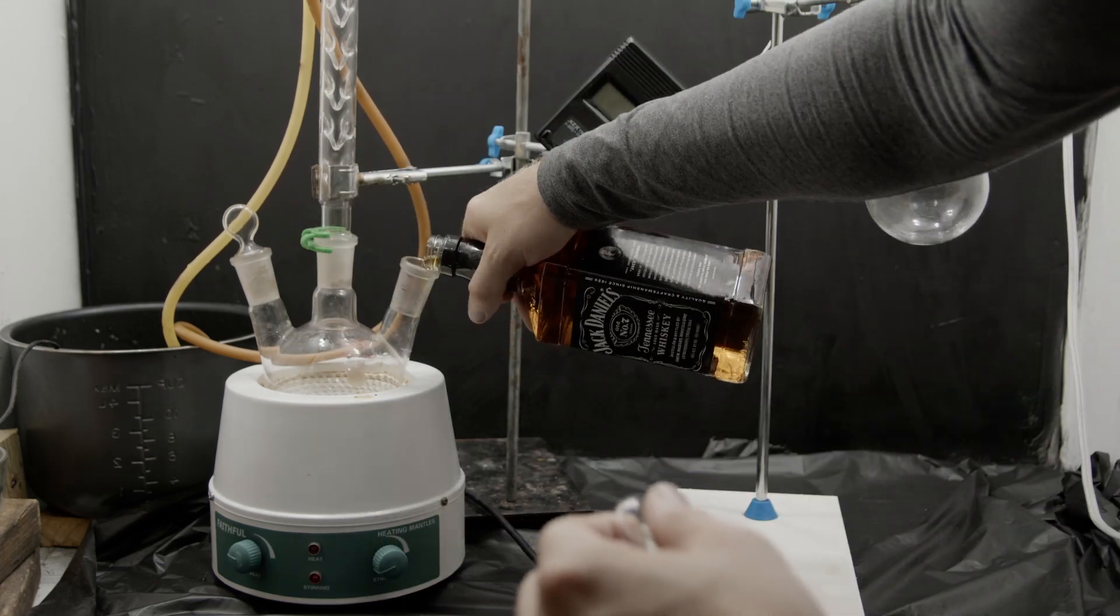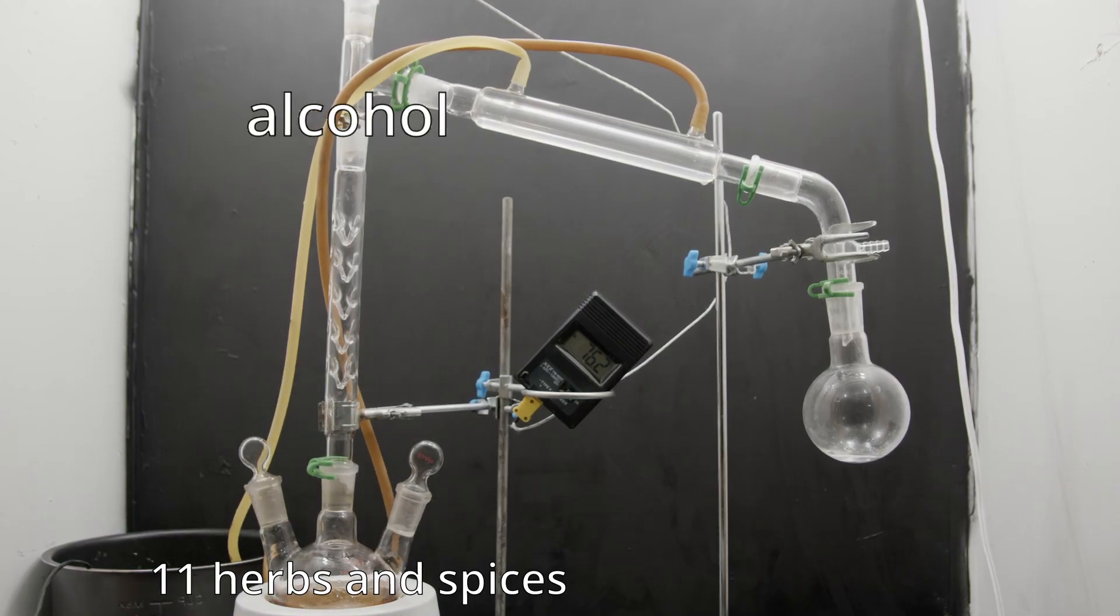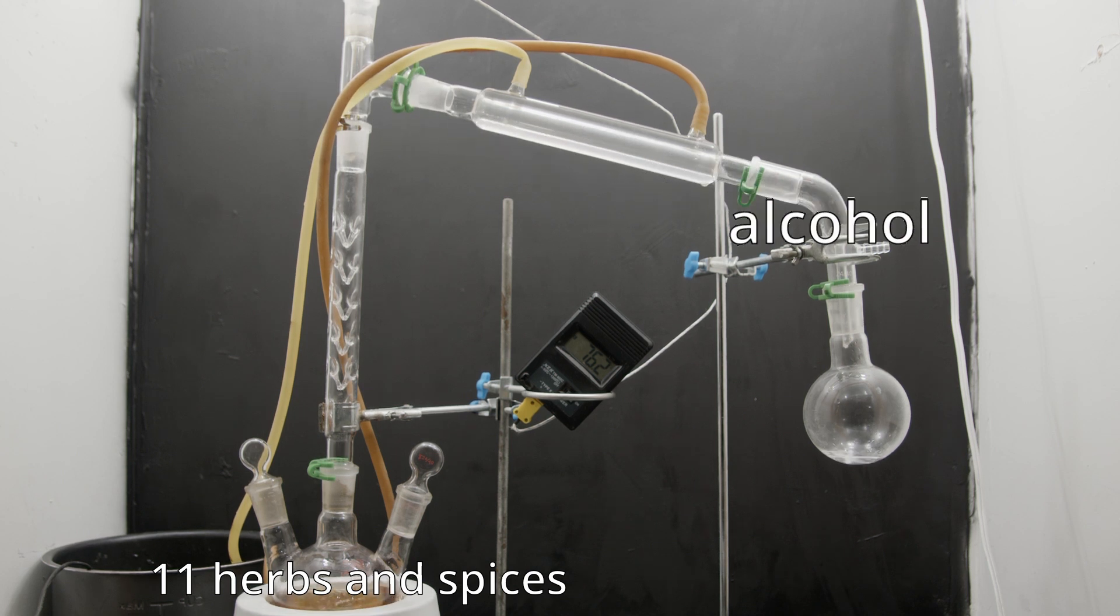And then we're gonna go into fractional distillation. With this we're hoping to separate the alcohol from the 11 herbs and spices in the Jack Daniels.